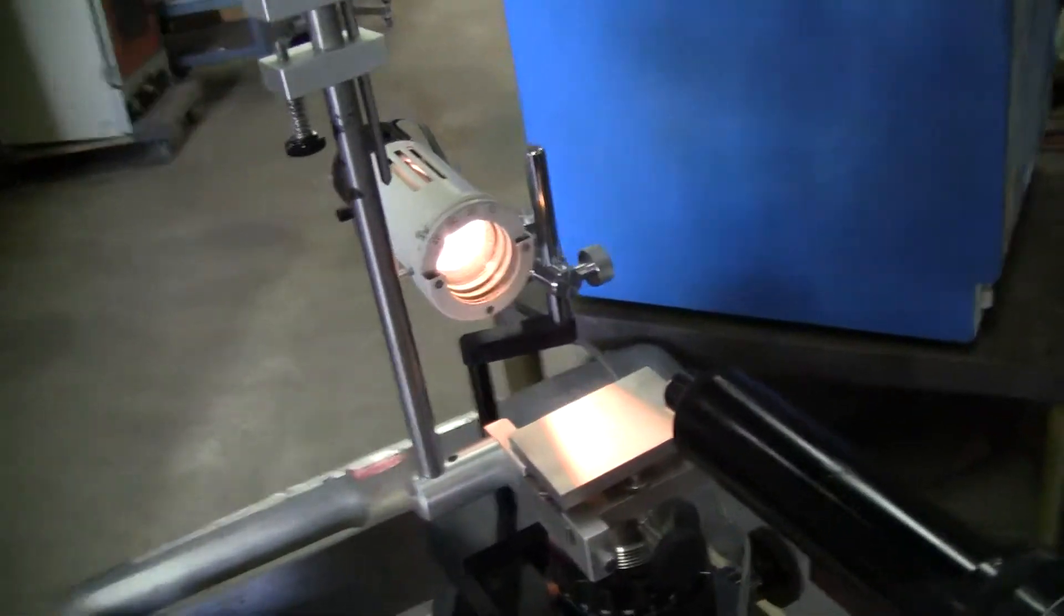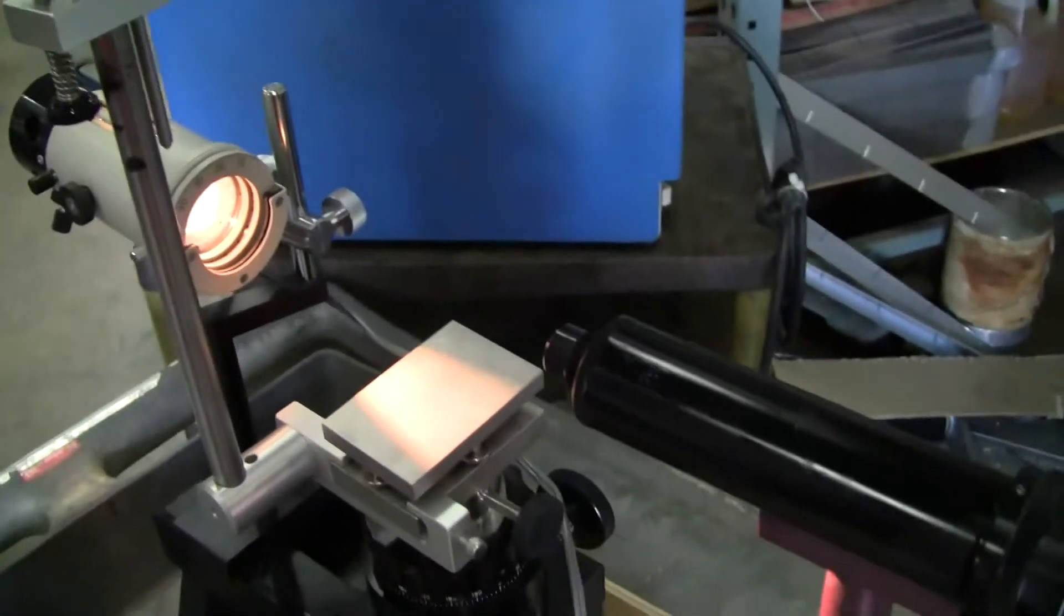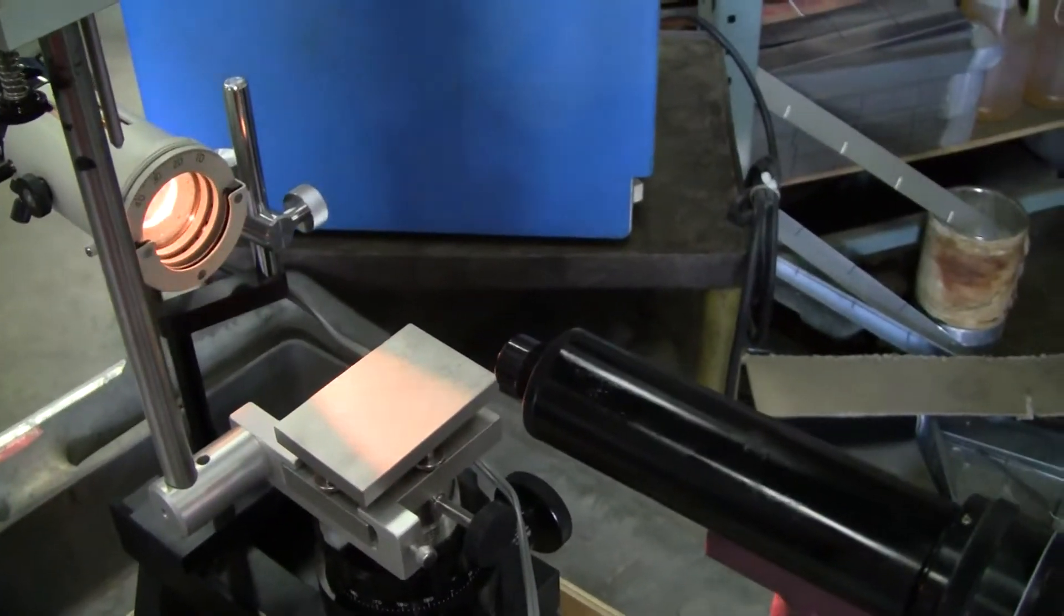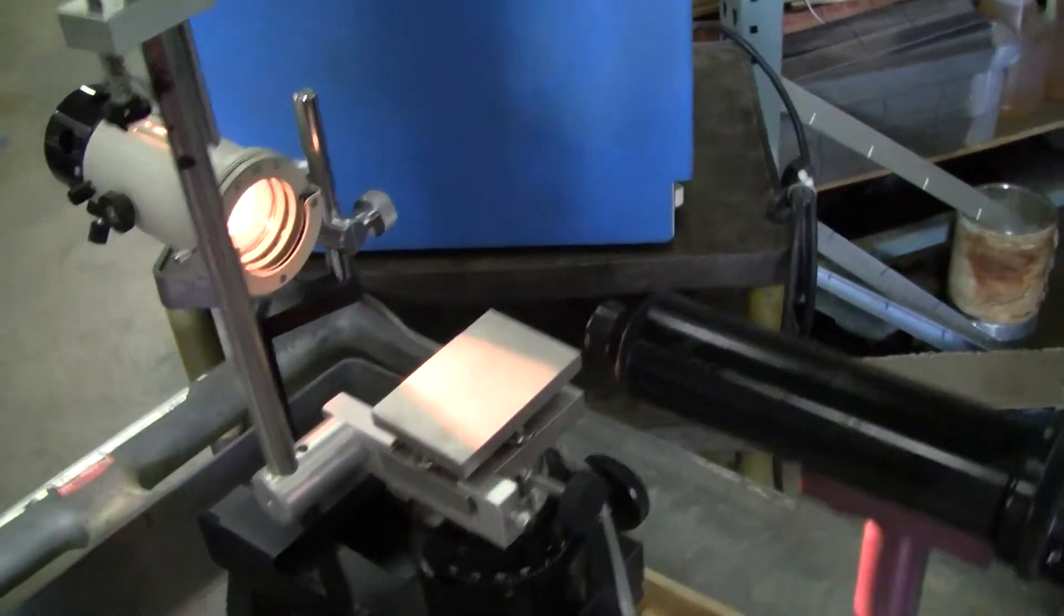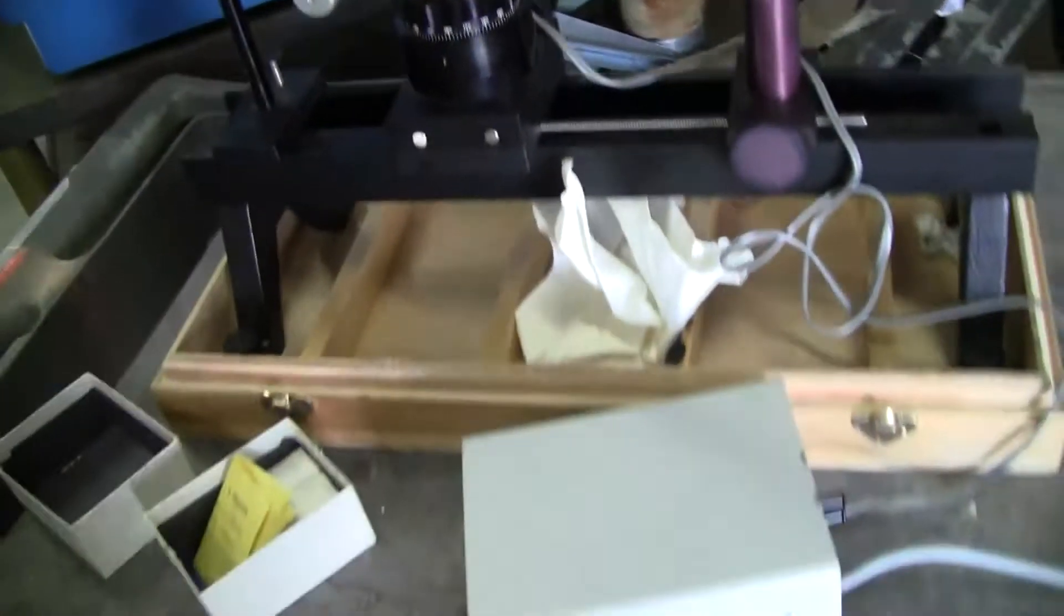First, take a look at the lamp. The lamp obviously works. Intensity can be decreased or diminished by the lamp controller.